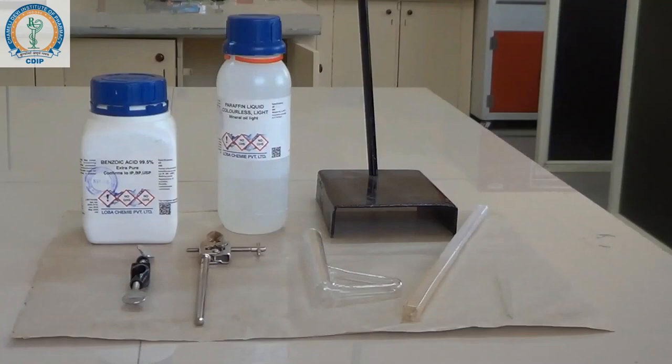Welcome to the YouTube channel of CDIP. Today we are going to determine the melting point of an organic compound.